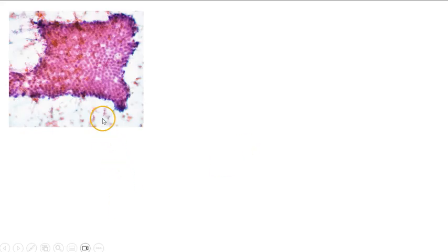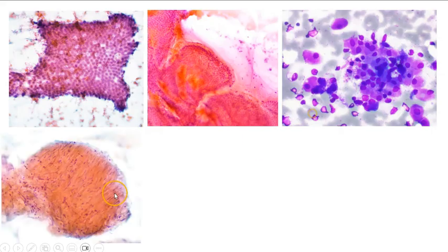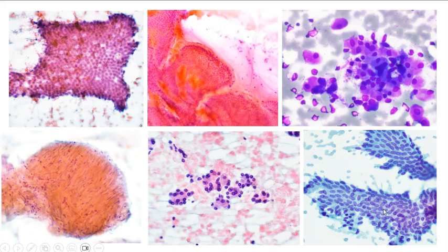So in summary, we have seen duodenal epithelium, which is recognized as a honeycomb sheet of cells with these goblet cells. We have seen gastric foveolar epithelium, which again show honeycomb sheets of mucinous cells, sometimes with thin background mucin. We have also seen gastric specialized epithelium, where we can see the parietal cells, which are usually very obvious and much larger than the chief cells. We have also seen Muscularis propria, where the spindle cells are a lot less tightly packed compared to GIST. And we have seen benign normal pancreatic acinar cells, as well as benign pancreatic ductal cells.